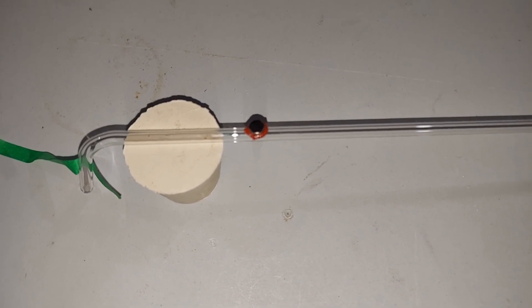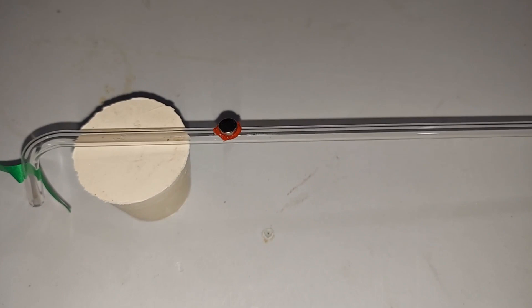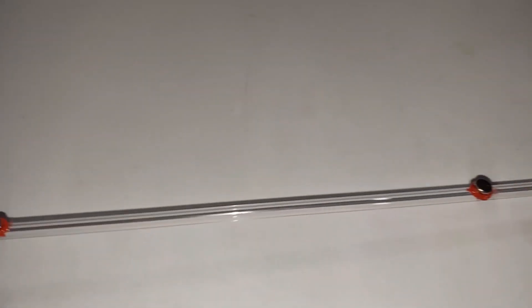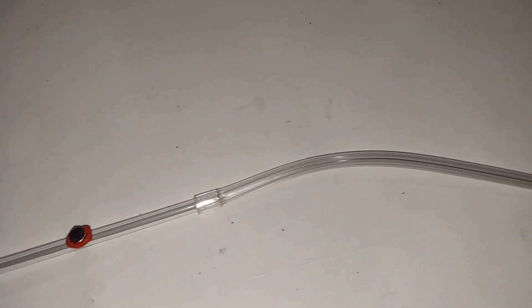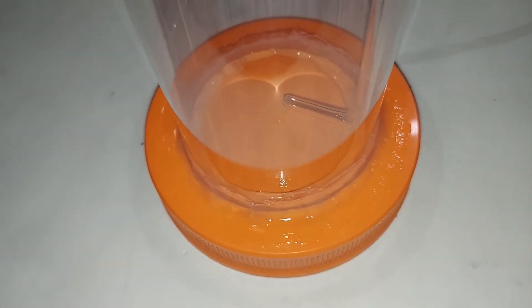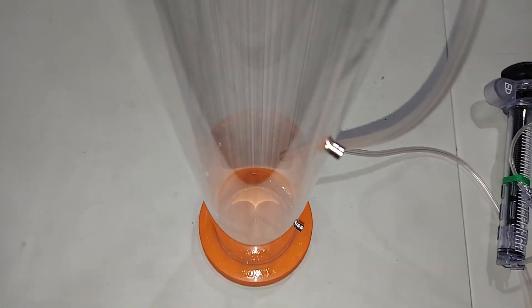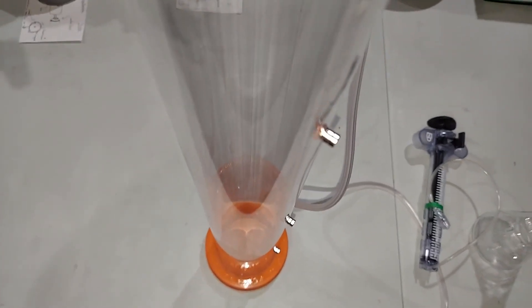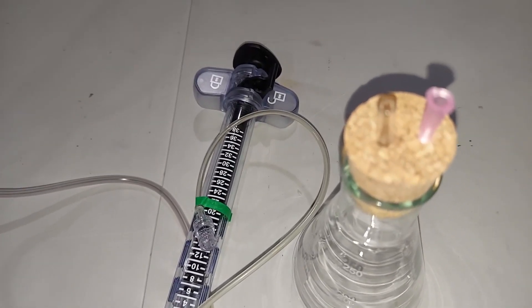To solve the problem of holding the tube upright inside the larger tube, I glued magnets with a high temperature resistant silicone — four of them on the tube — and I'll be putting magnets on the outside of the polycarbonate tube to hold it there. The chlorine gas will be coming through almost in the center, and I use two magnets on the outside to hold the tube straight, which works great. I'll be using this to add the hydrochloric acid to the bleach through two openings in the top.